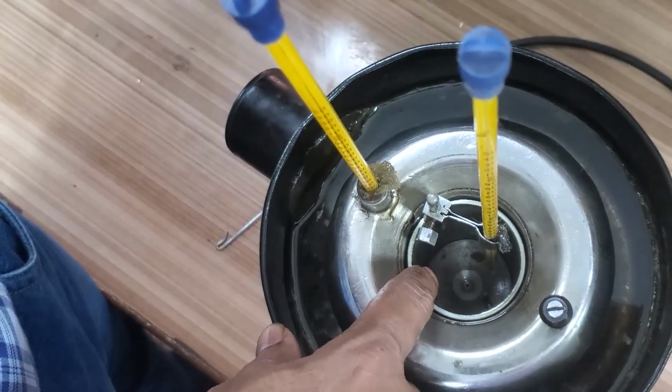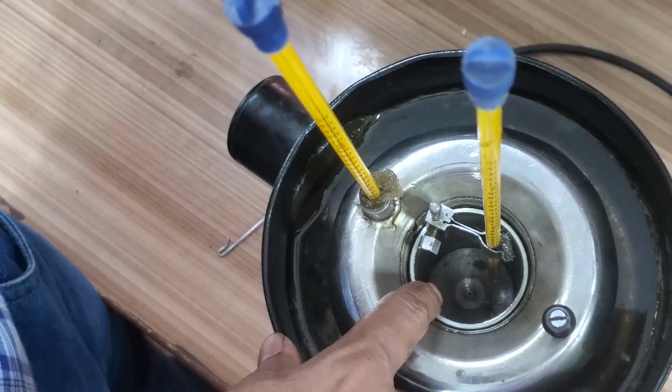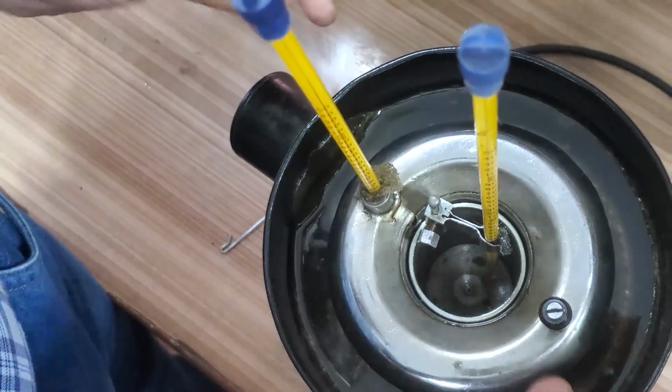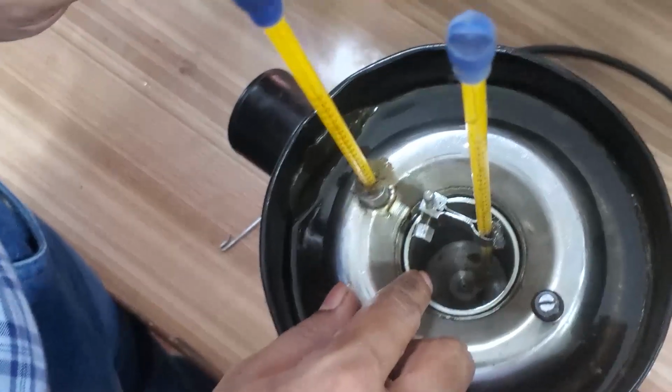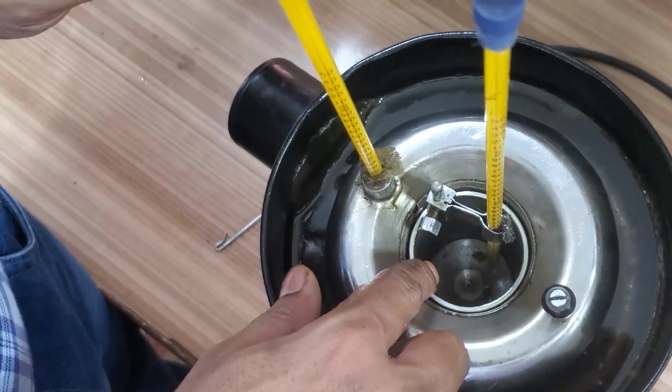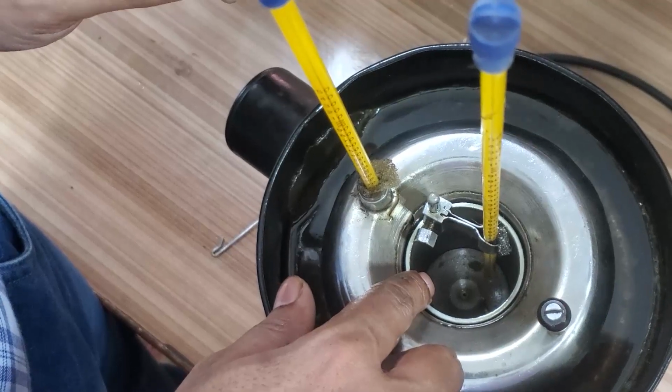This is Redwood viscometer 1. So at the center you can see the orifice. In the other direction, if you tilt this one, you can clearly see the orifice in this container also. So we will show in that mode also.